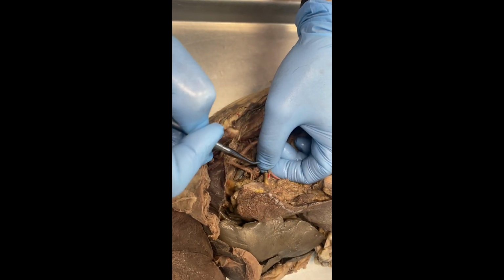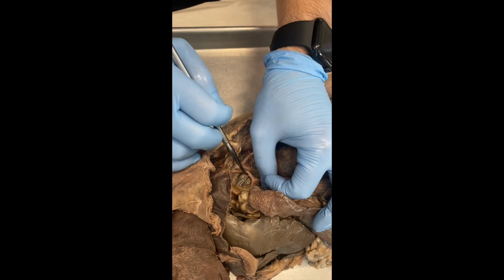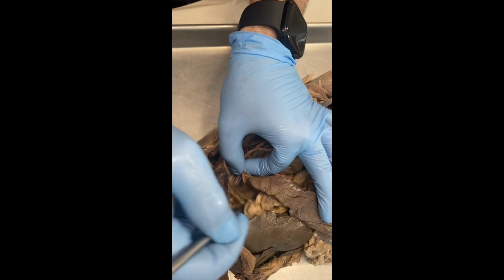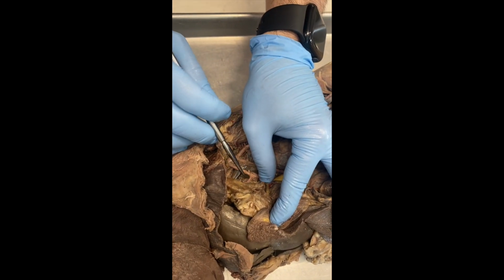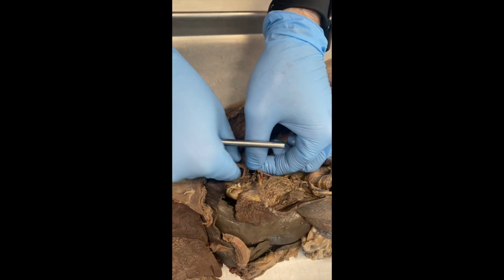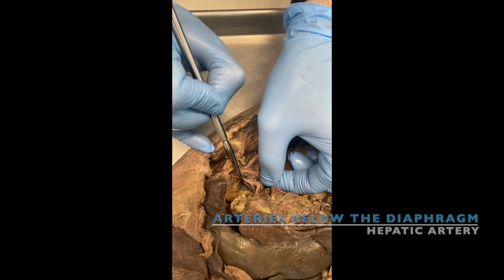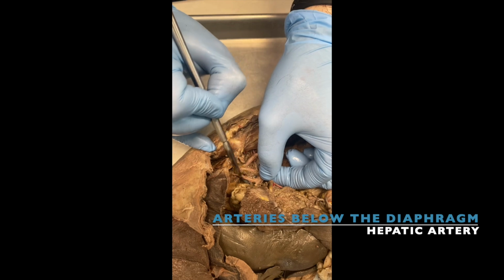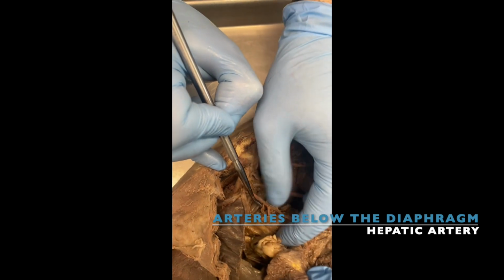Let's see what we have here. So this one, it's kind of damaged, but you know, we can see in other cats. This one should be your hepatic, but see how I cut through it? That should be your hepatic artery.